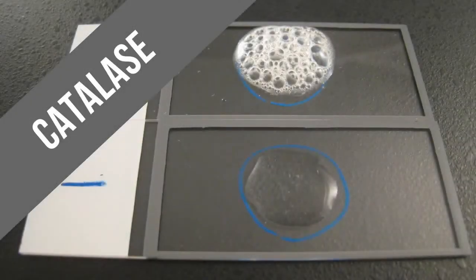Another test that you can do that's super easy is the catalase test. The catalase test simply requires a blank slide.